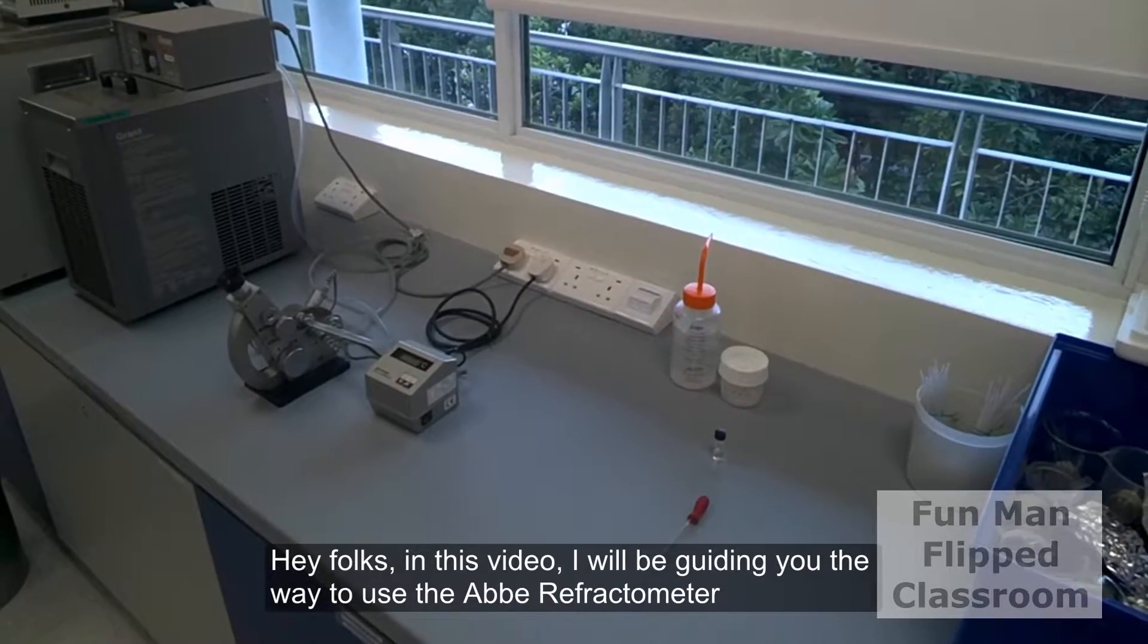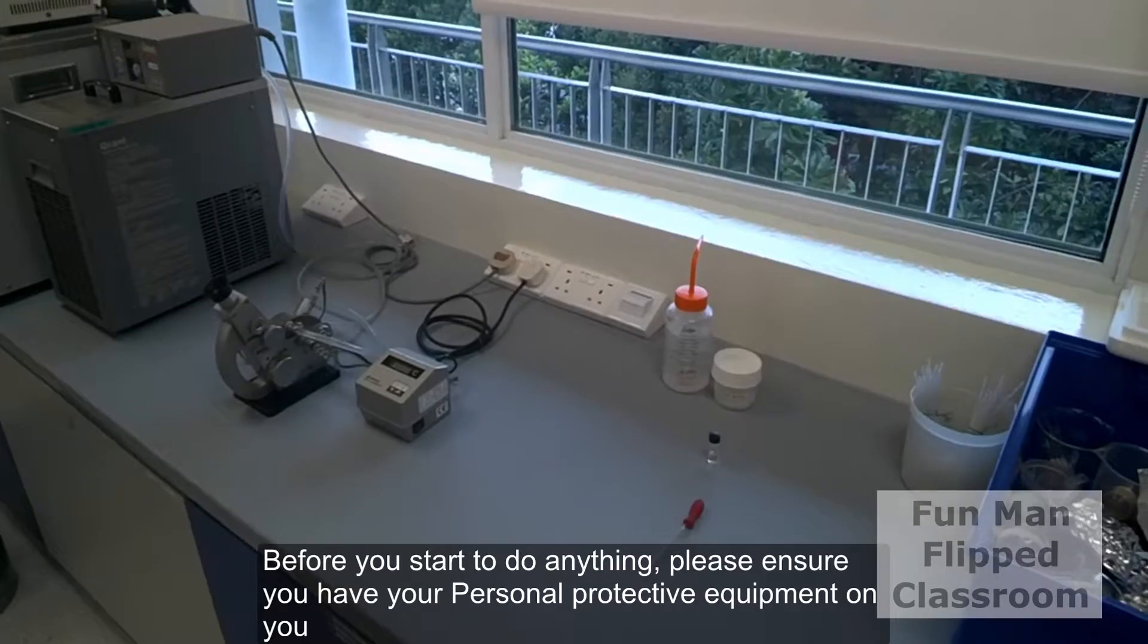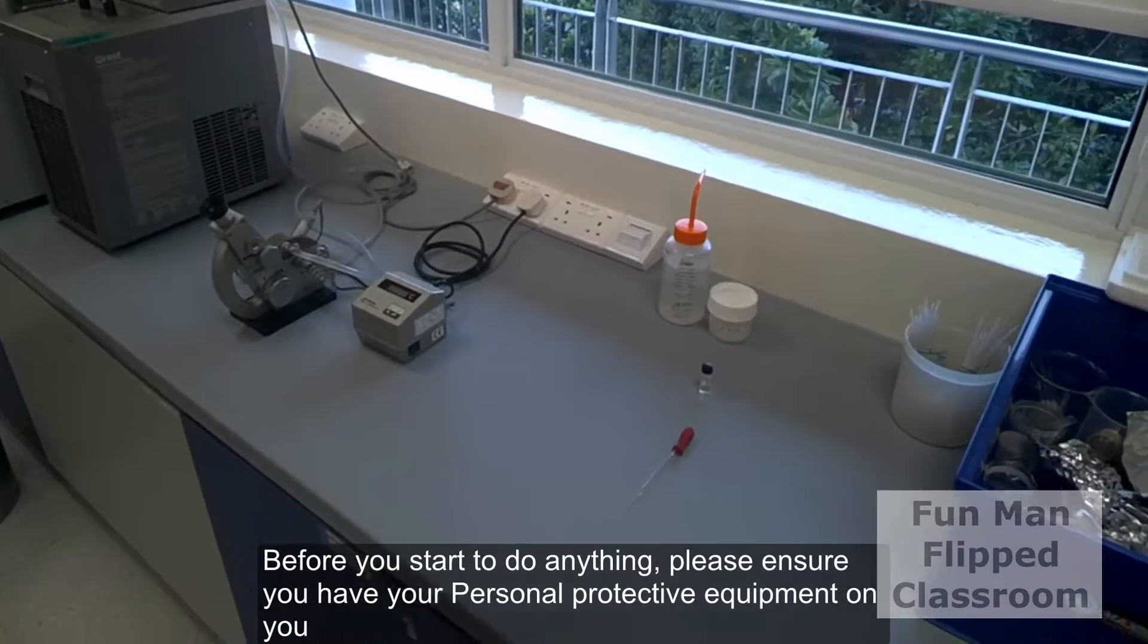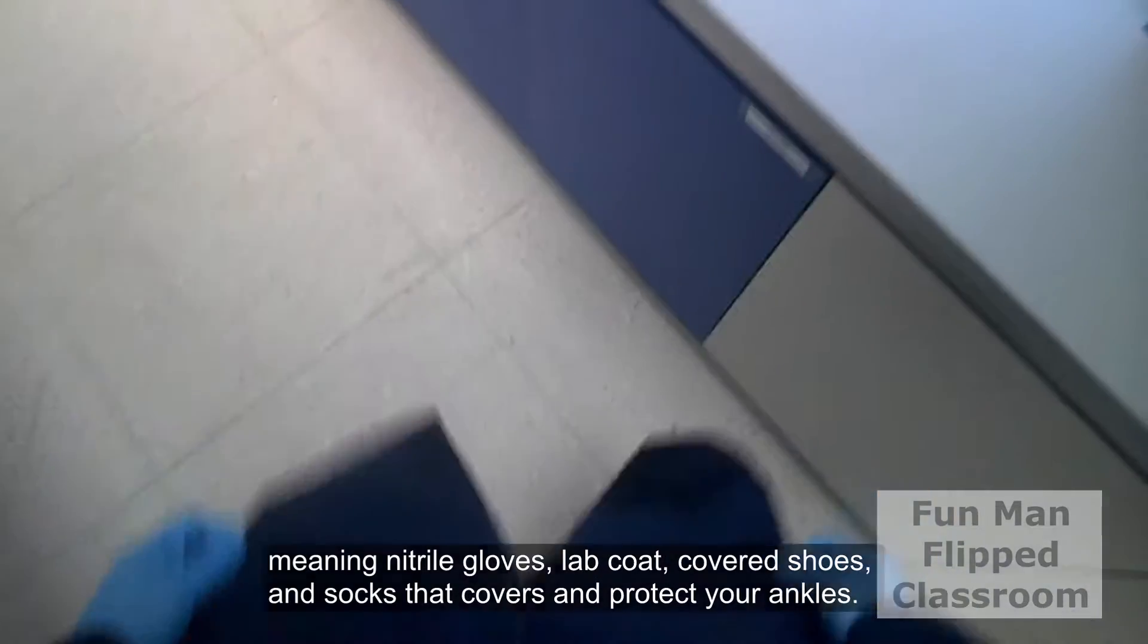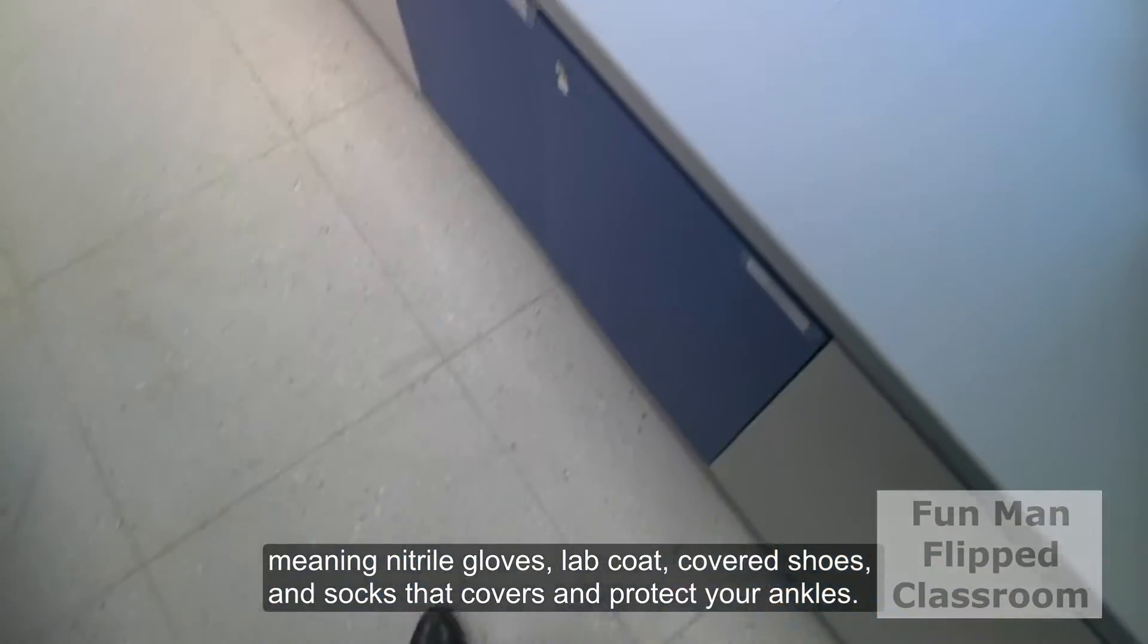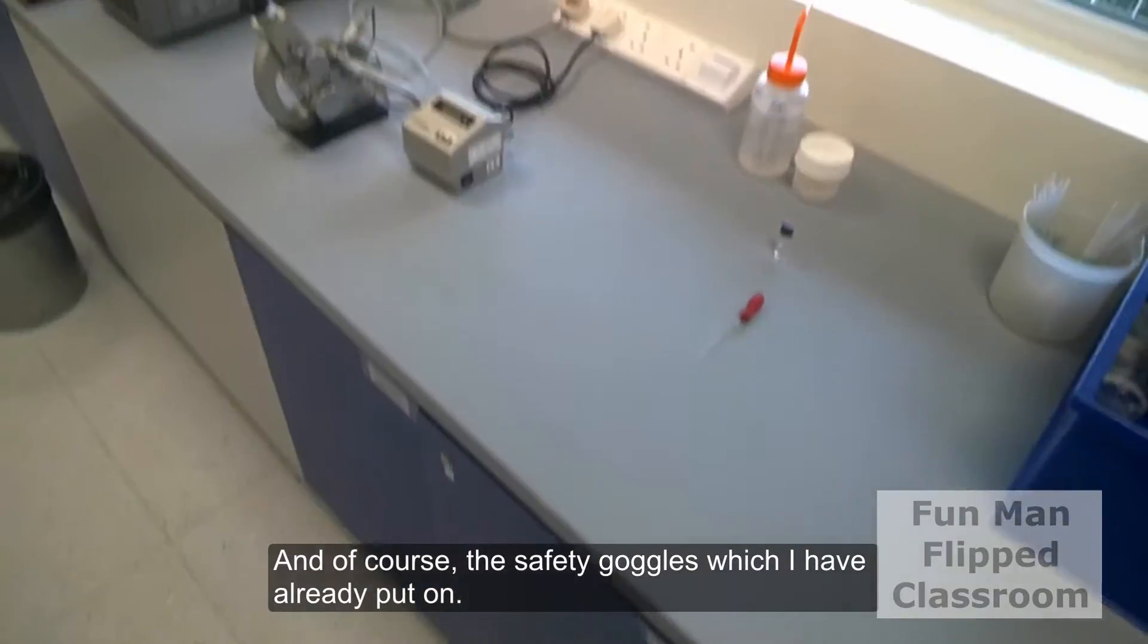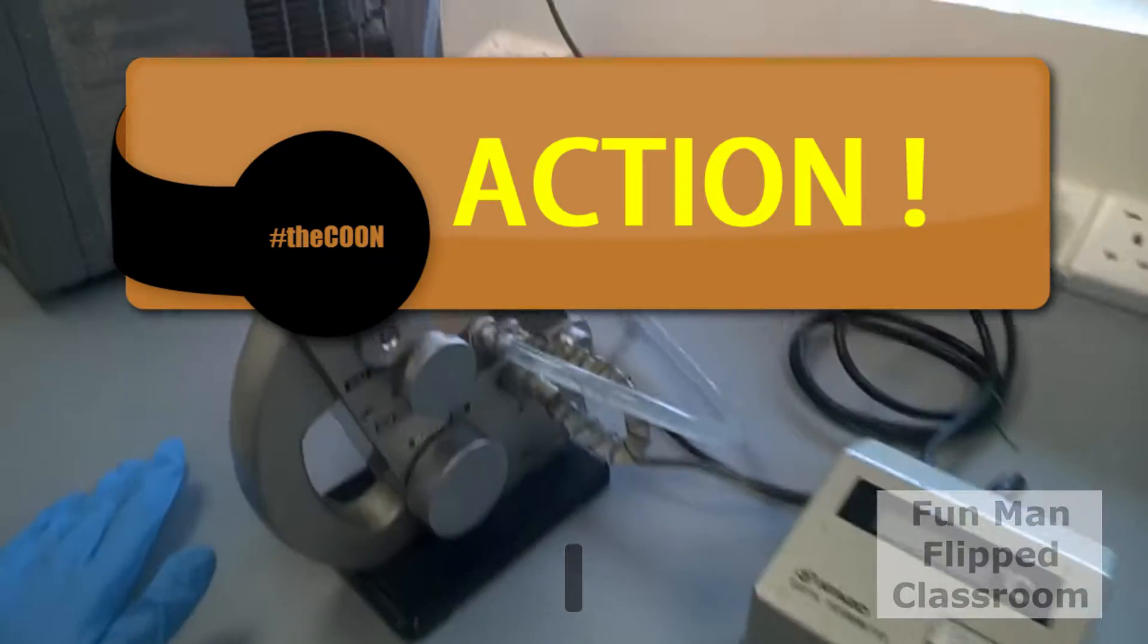Hey folks, in this video I'll be guiding you the correct way to use the Abbe refractometer. Before you start to do anything, please ensure you have your personal protective equipment on you, meaning nitrile gloves, lab coat, cover shoes, and socks that cover and protect your ankles. And of course, the safety goggles which I have already put on. Okay, now we are ready. Action!